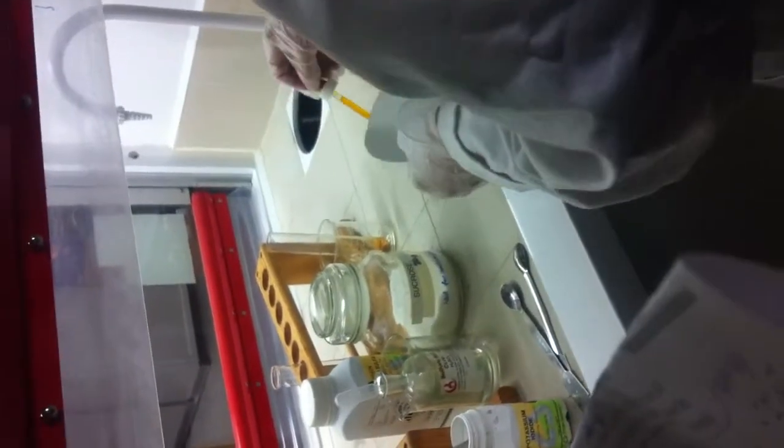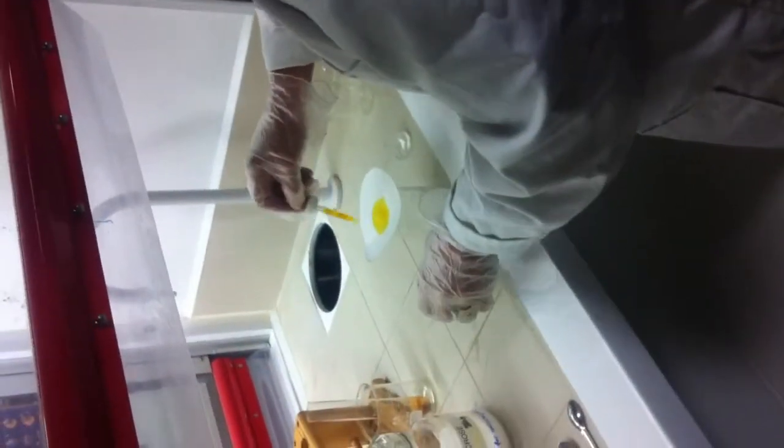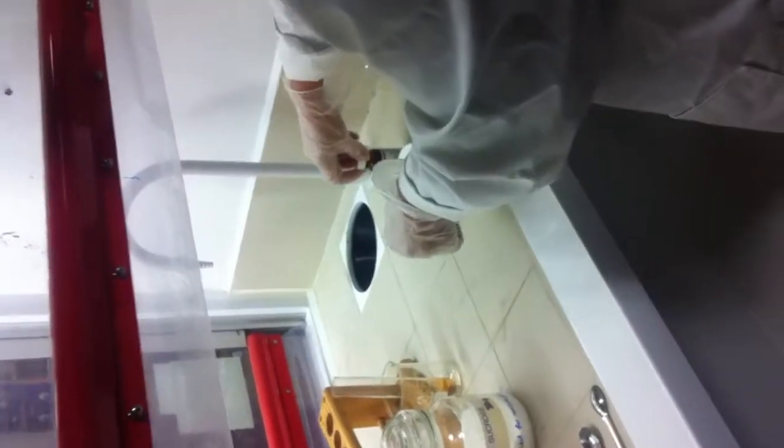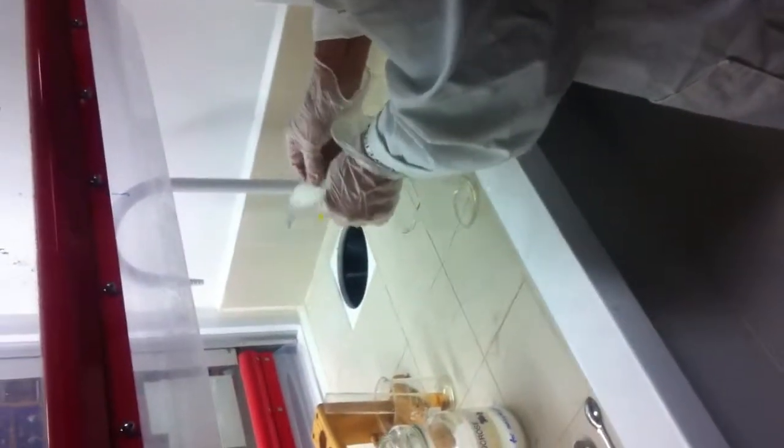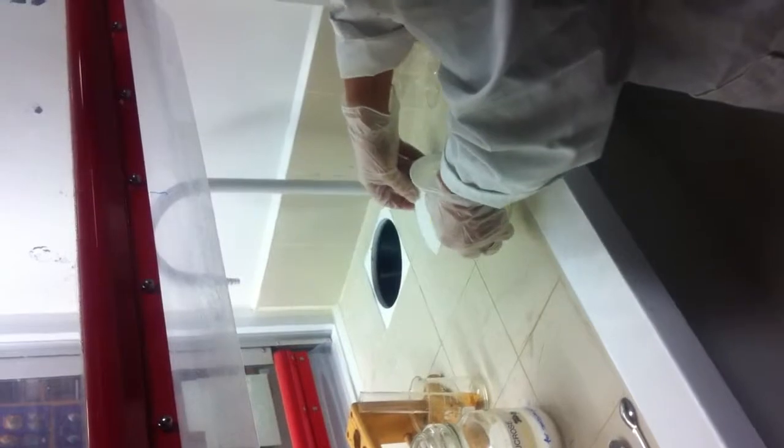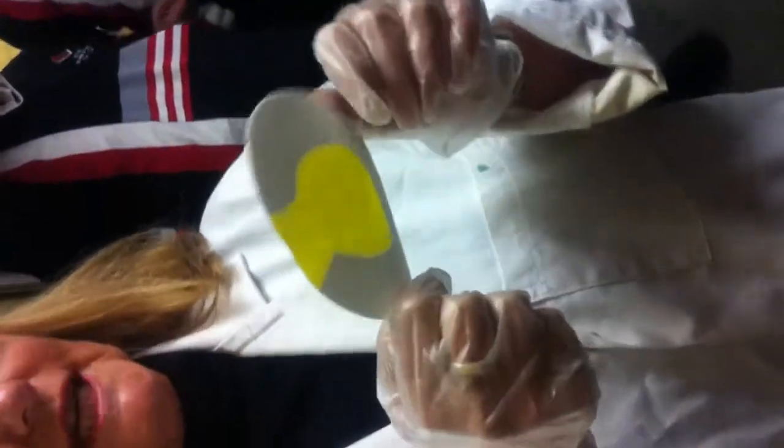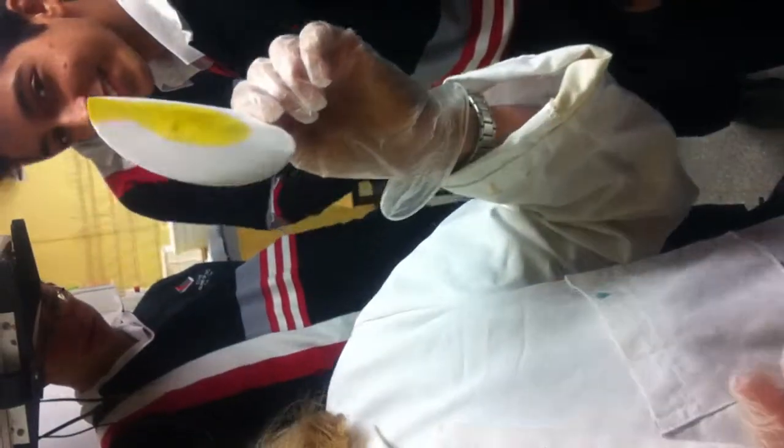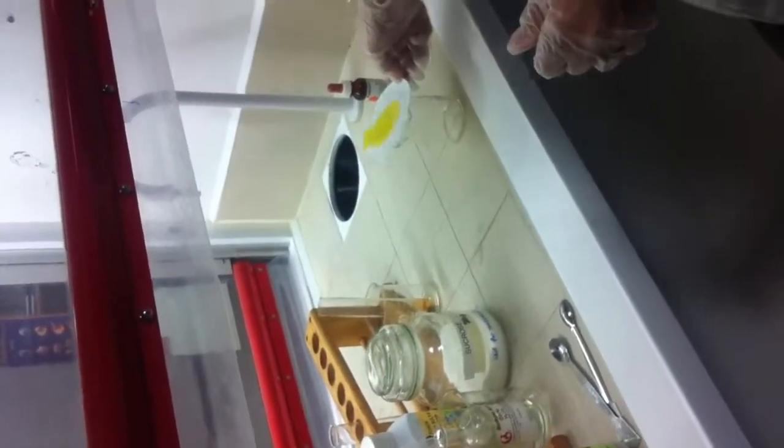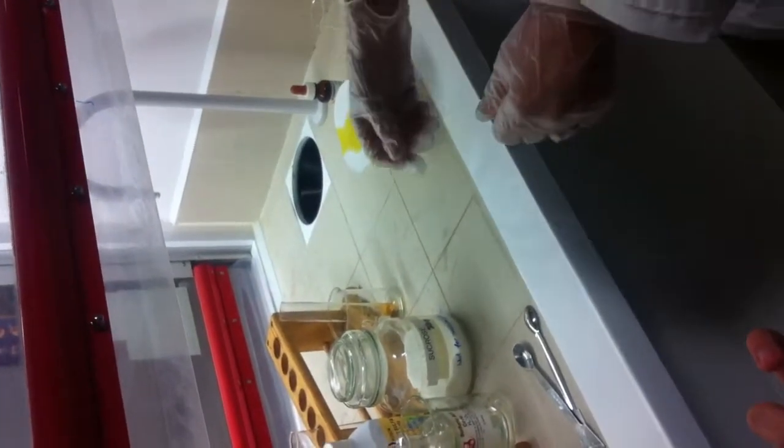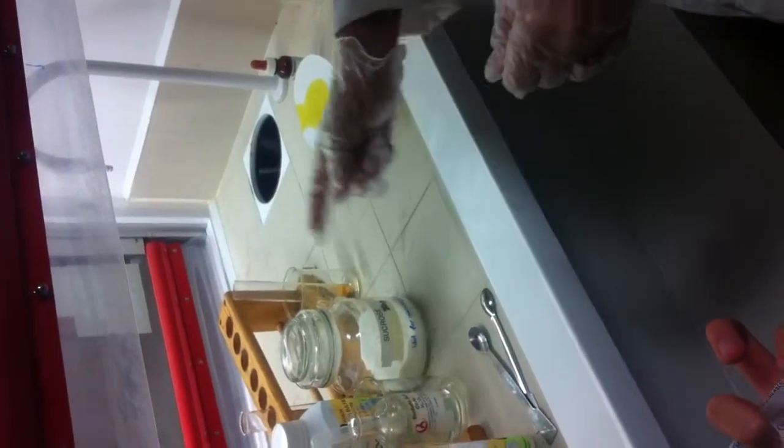Soaking filter paper into potassium dichromate. I'll go get a piece of filter paper off the lab assistant. Soaking a small filter paper into potassium dichromate. Just one piece. It should have placed it over the mouth of the reacting tube. Placing it over the mouth of the reacting tube.